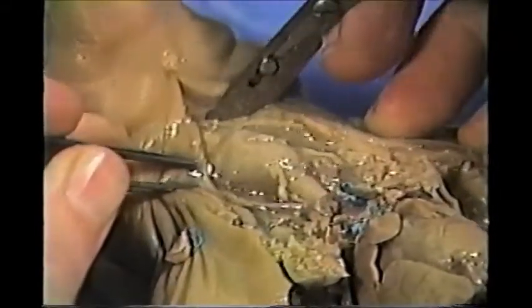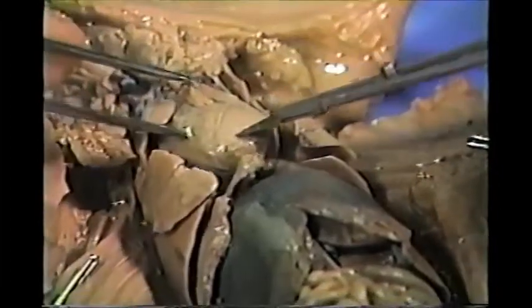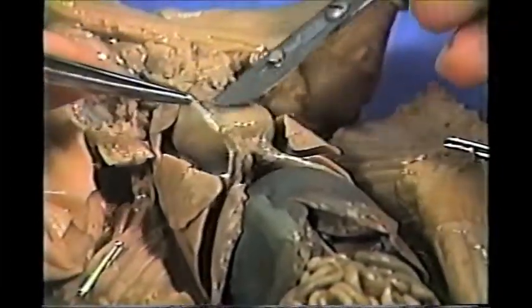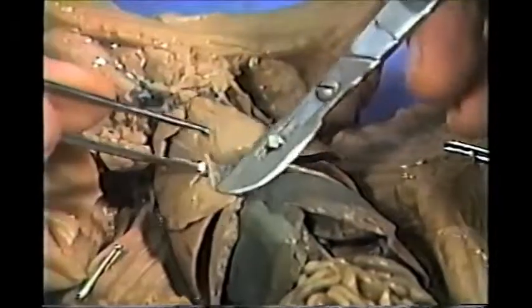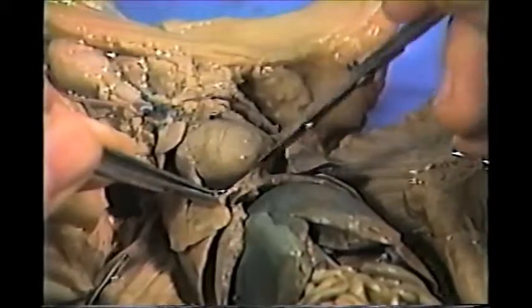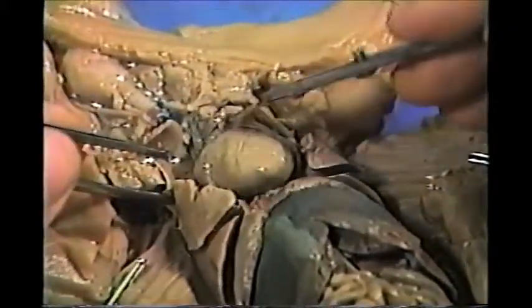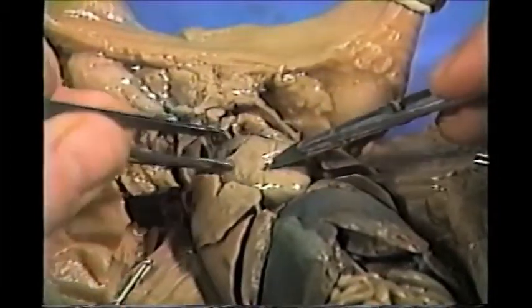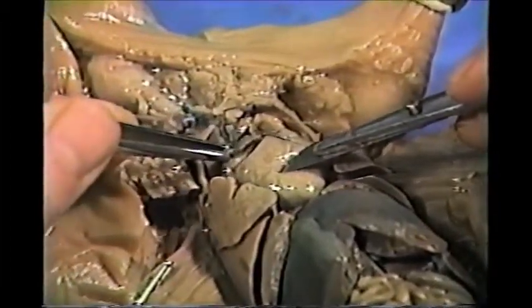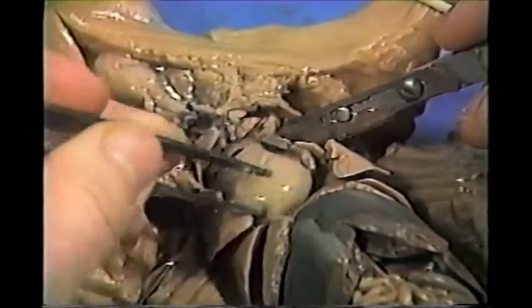Okay. So let's move down. In the chest cavity, this structure right in the center is the heart. The heart is right underneath the sternum. Here's that pericardial sac that I cut earlier, and I'm going to remove the rest of it so you can see the heart a little better. And we'll do a heart dissection later on in the course. These are the ventricles. This little thing up here is one of the auricles of the heart, and we'll say more about that in another video.